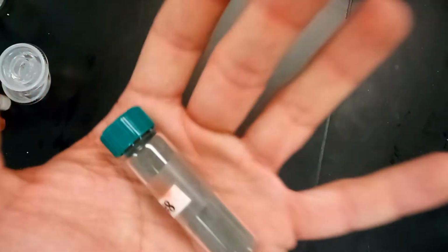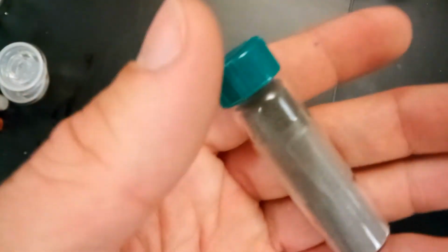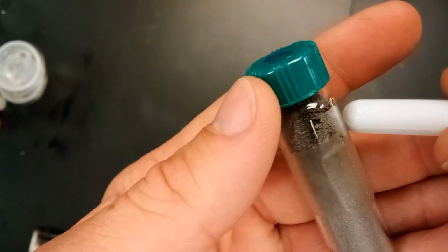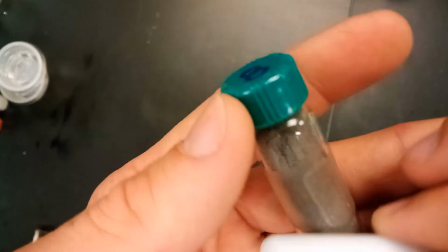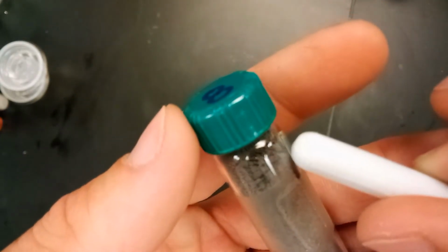Right, here we are with number 8. This is another seemingly fine metal. Just like we did with the other metal, there are 2 things we're going to test: 1, whether we can write with it, and 2, whether it's magnetic or not. The first one, magnetism, we can figure out using one of these magnets. So hopefully you can see that it is moving with the magnet. So this is a magnetic metal, just fine chunks of it. It's actually kind of fun to watch, but that's just one of the indications for number 8 here.